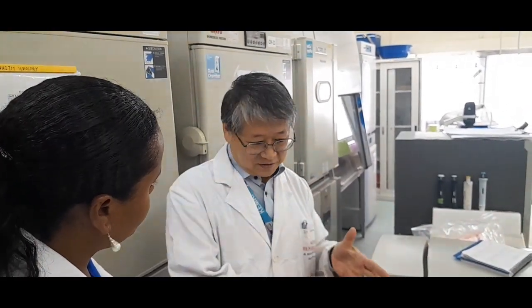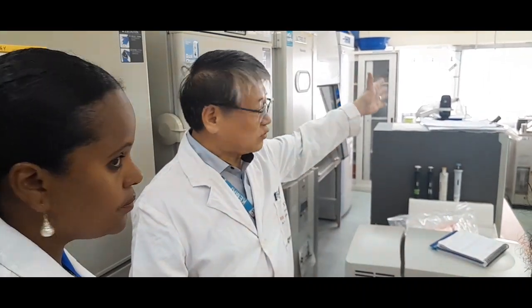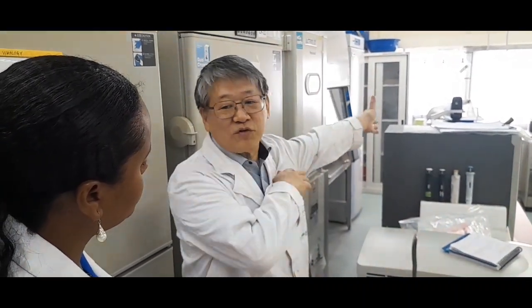Even if someone is using one, you can still use the other when you finish your work. If you have only one and somebody is using it, you have to wait until that autoclaving finishes. So to minimize the keeping of infectious material waste, we have two, and immediately when you finish your work, you should do autoclaving.